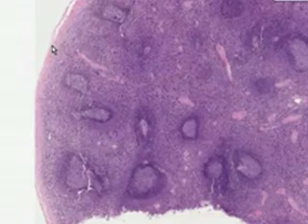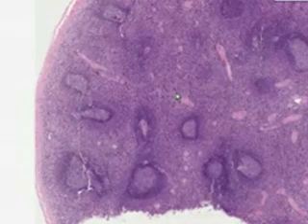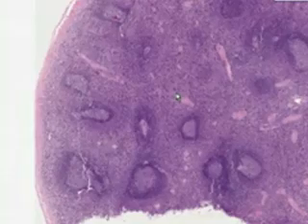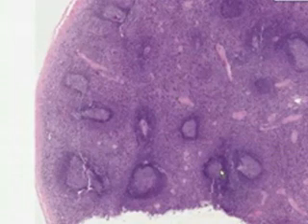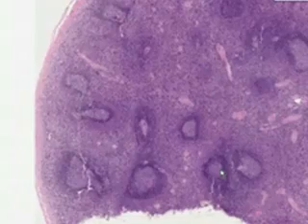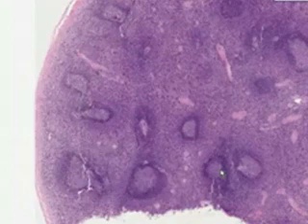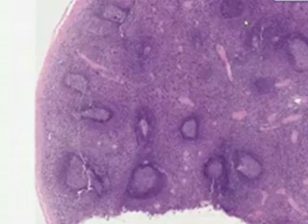If a spleen is enlarged, it could be enlarged because of the red pulp, like if there was a lot of congestion within the spleen, or it could be enlarged because of the white pulp, because perhaps there was some process of infection causing these lymphoid areas to hyperplase or increase in cells, or perhaps proliferate because of a neoplastic process such as a lymphoma. So it's very, very nice to get a feel for red pulp and white pulp.